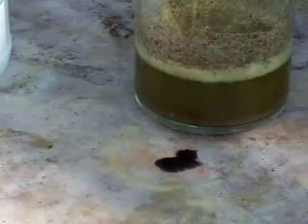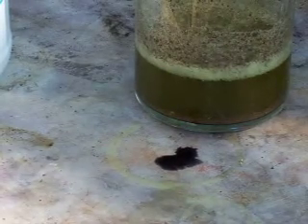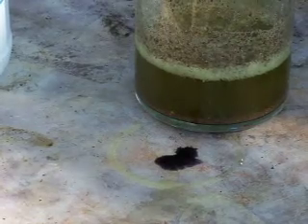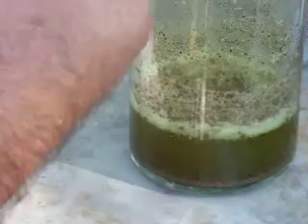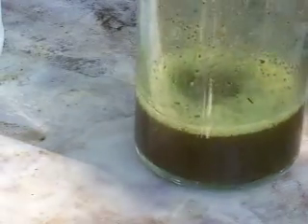The filter goes in the colander and then the whole thing sits on top when I filter — that's a little system I've got worked up. I really didn't mean to spill this, so I'll use that filter to wipe up my little spill. This filter will be processed later with the rest of my filters — that little bit of gold will be reclaimed.